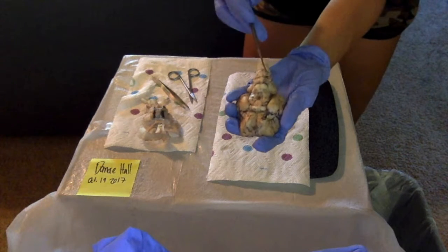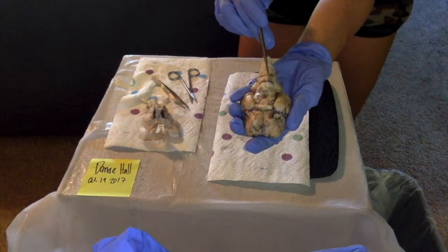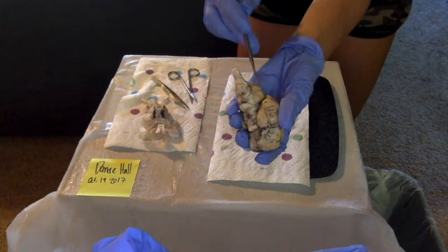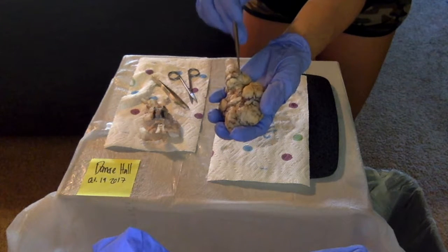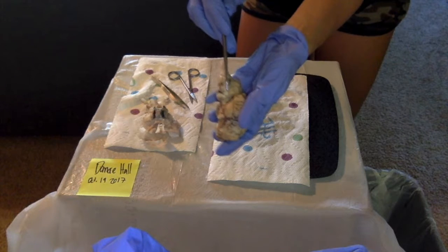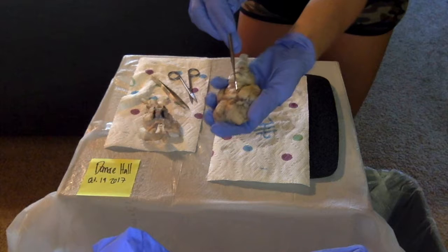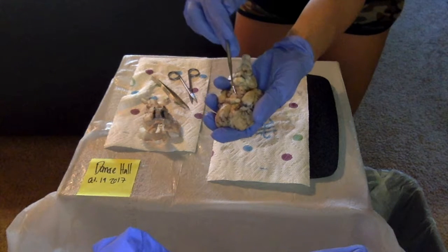So right here, we have the medulla oblongata. Above that is the pons. To the side of that, right here, is the cerebellum. And then we have the meninges right on the side of the pons, this light-colored piece, right here. And then the midbrain is right in here, this piece right here. And the optic tract is right here, this piece.